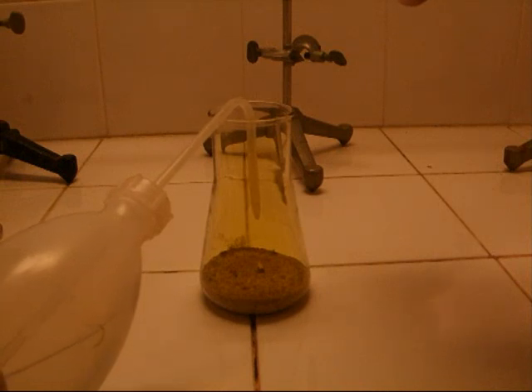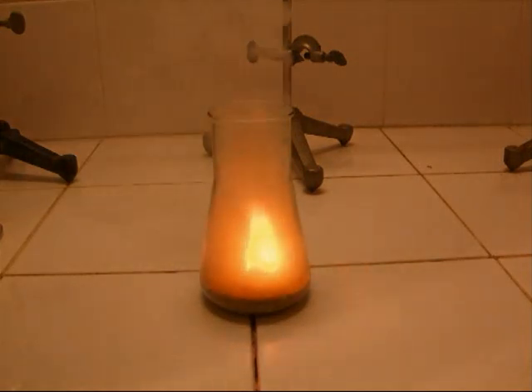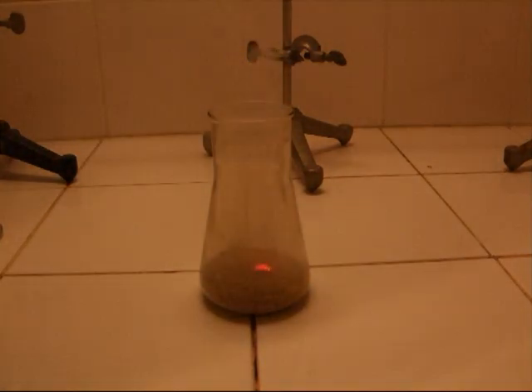As product of the reaction of the sodium with the chlorine, we have normal table salt. But it's not recommended to taste it.